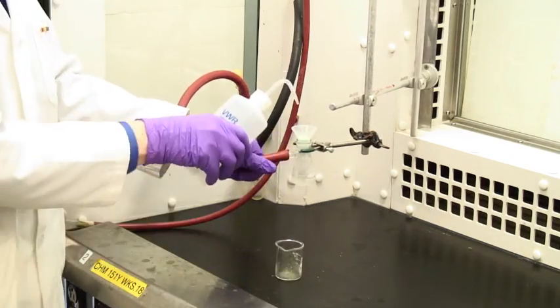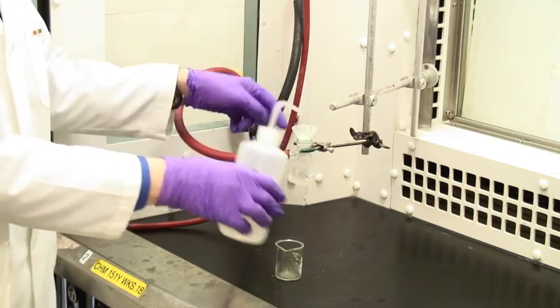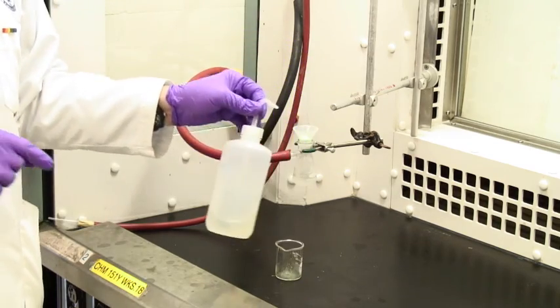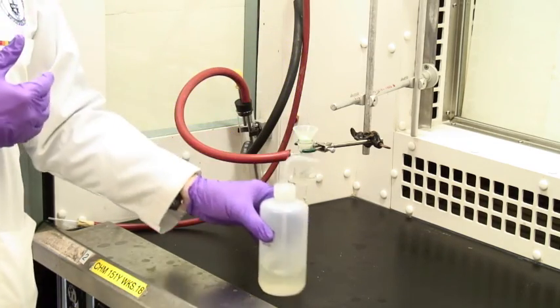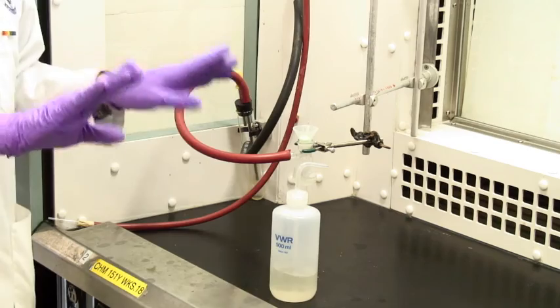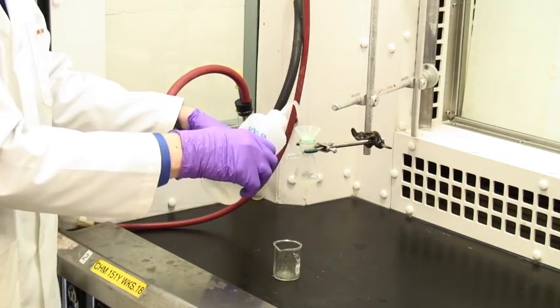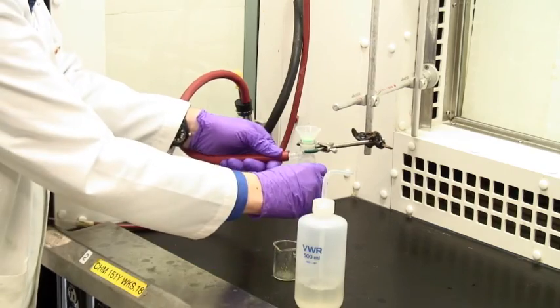Don't do this, that is add the liquid while the suction is happening. If you do that, only the solid that's underneath the wash stream gets washed and the stuff at the sides of the filter never gets washed. So always disconnect, add the wash liquid and then reconnect.